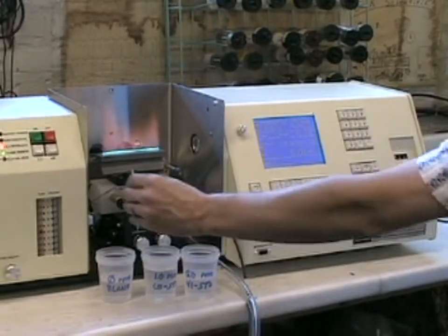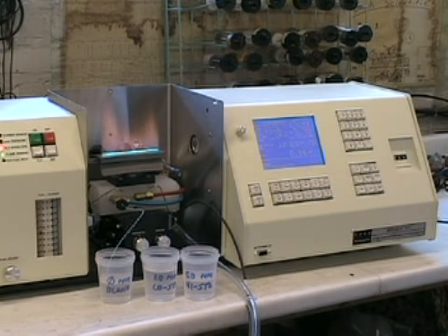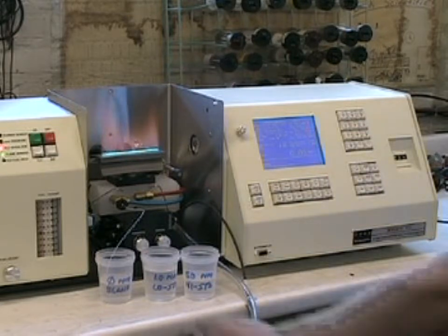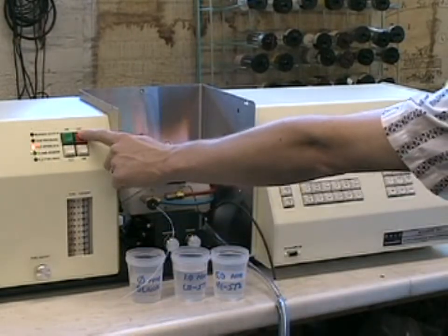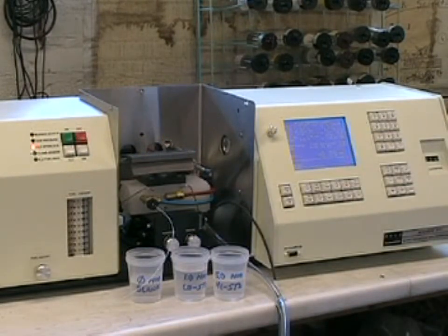At the end of our analyses, go into the blank or some dilute acid rinsing solution and allow any salts or residual samples or standards to be flushed from the burner head and the spray chamber. Remove the Teflon line from the sample rinse cup. Let the burner head run dry for a few seconds and then press the red off key to automatically and safely extinguish the flame. At this point, we can either change our element for air acetylene work or change our burner head to begin to do nitrous oxide acetylene work.